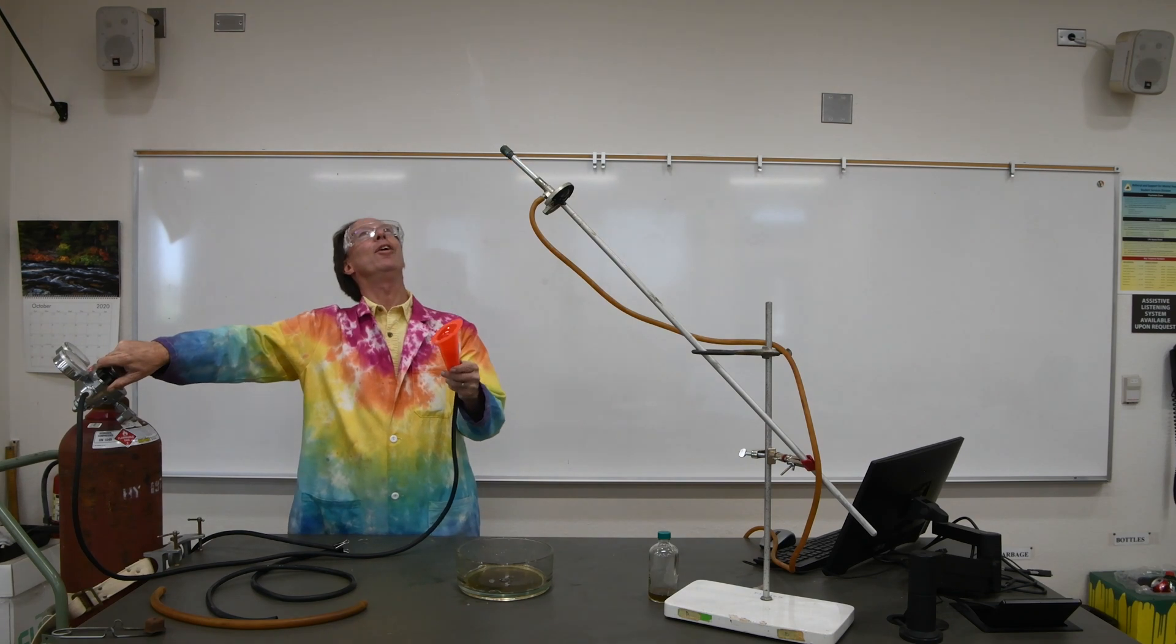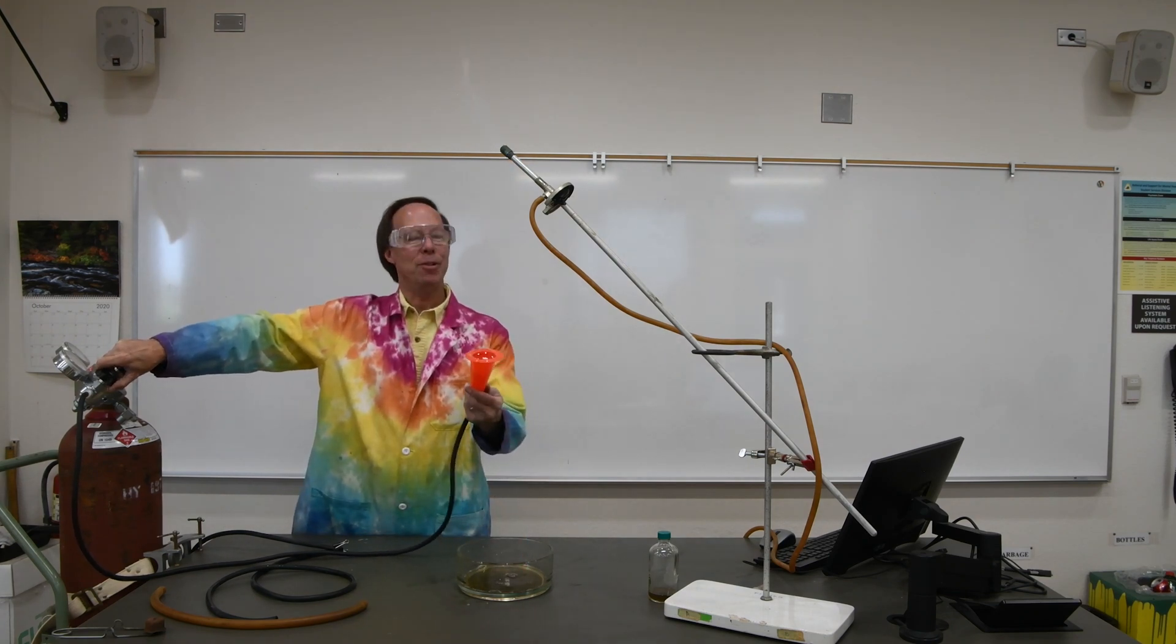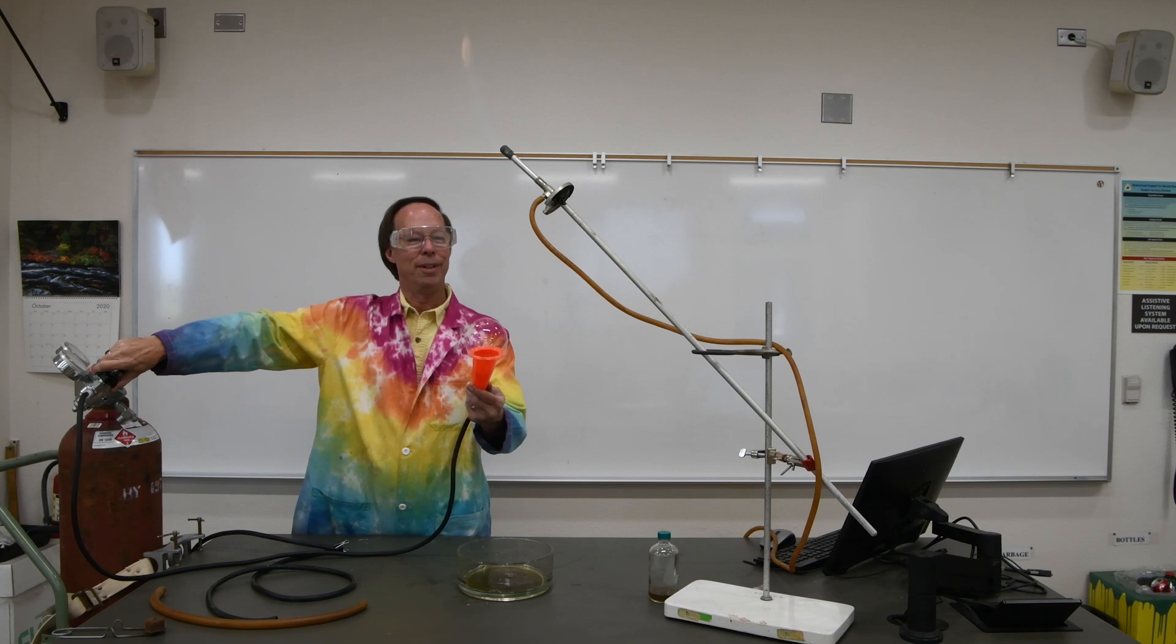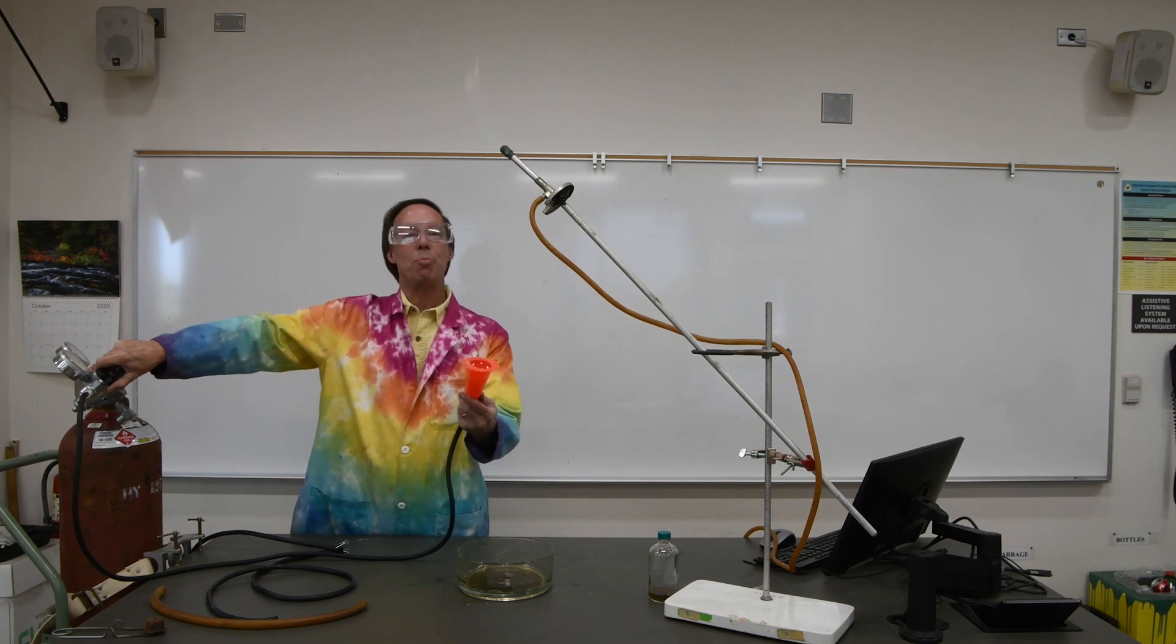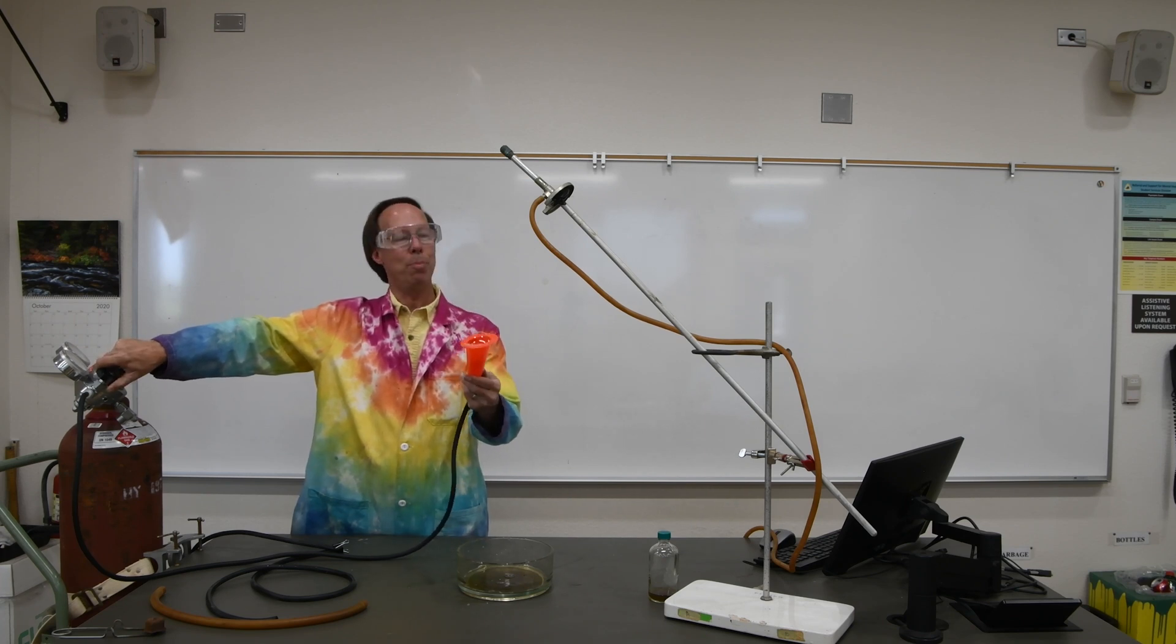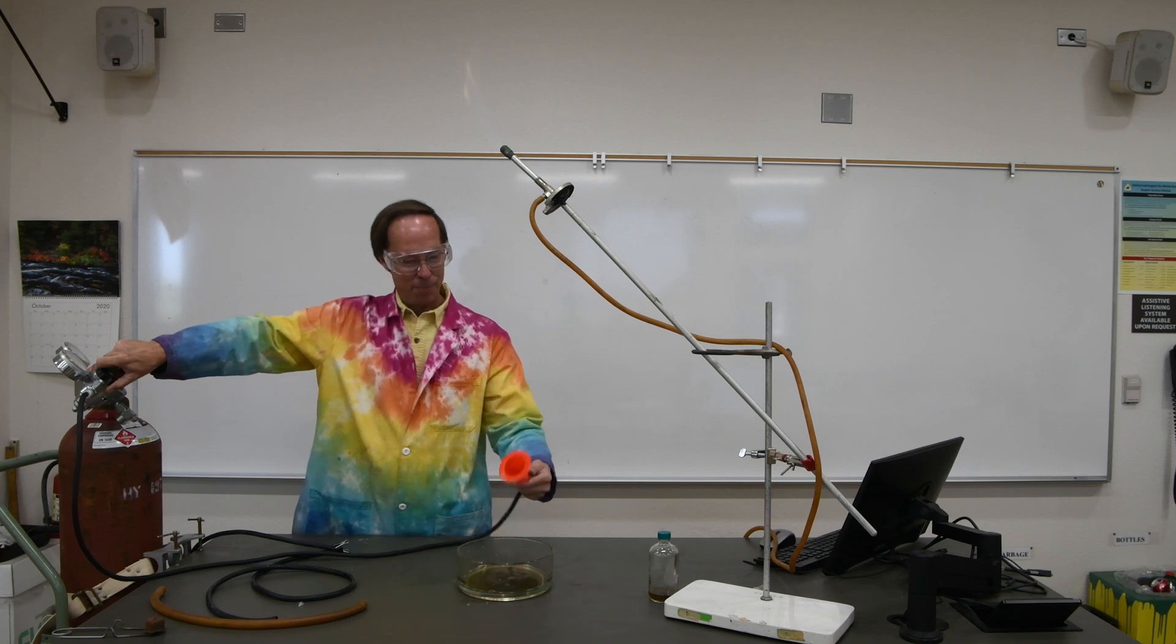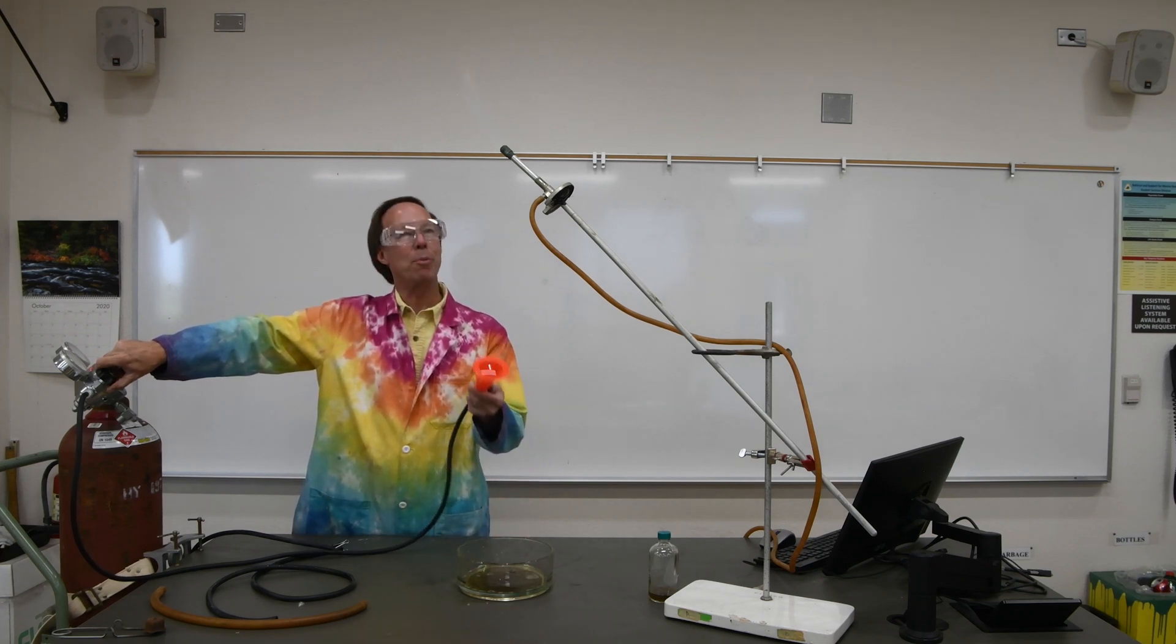There we go, got a little bit of pop there. Let's try another one here. You get a little more of a pop with hydrogen because it's much more flammable and explosive than natural gas. Let's even get one more here.